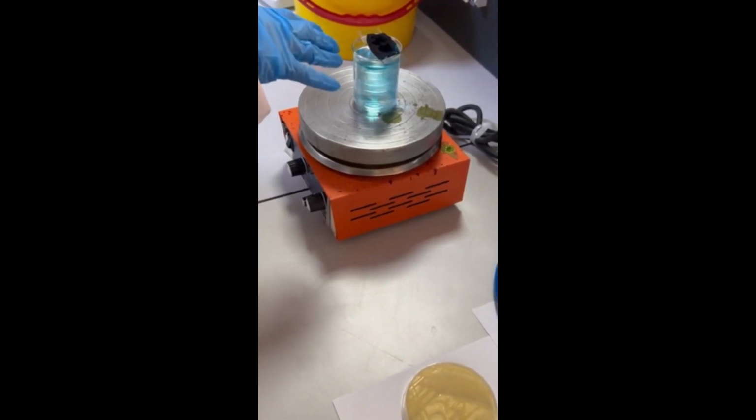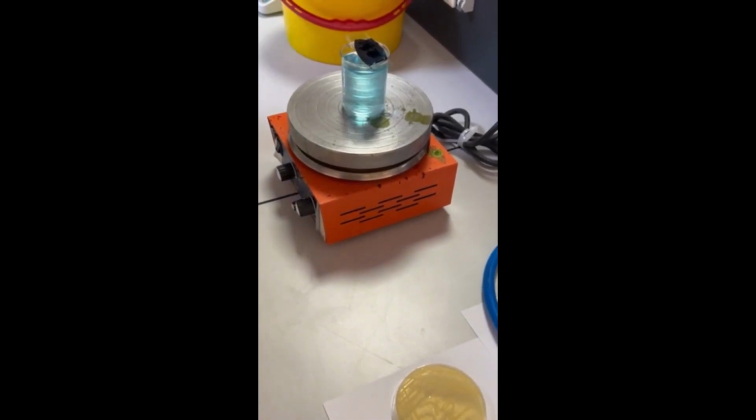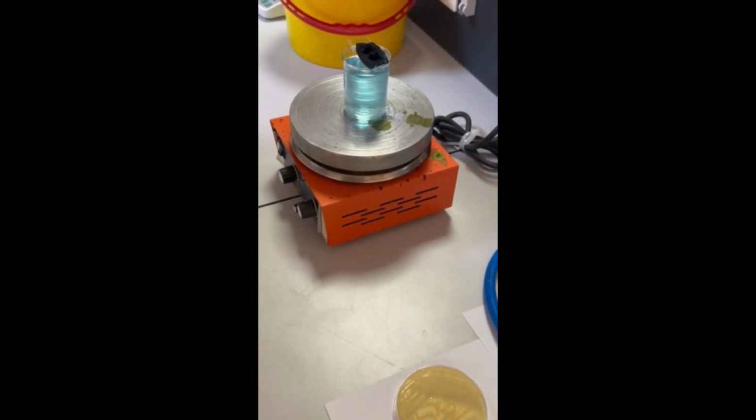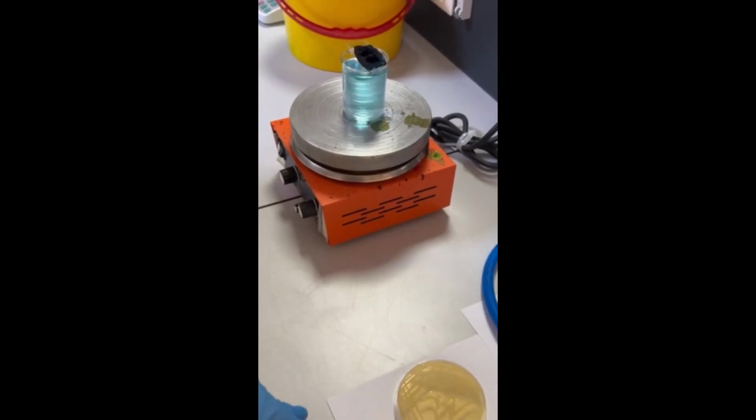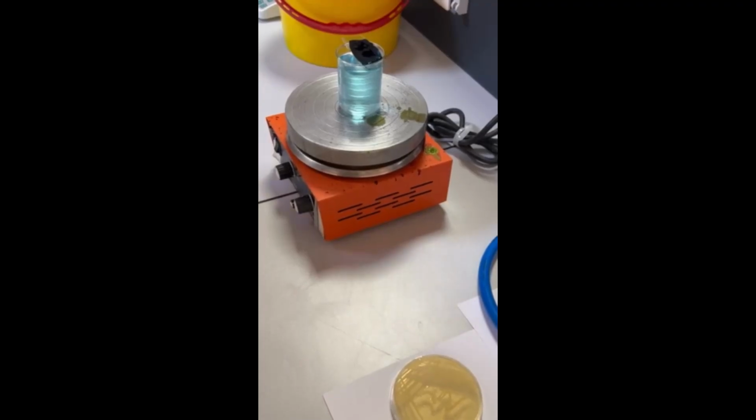During this step, all bacteria will take the green color, the color of the primary stain, malachite green, the spore and the vegetative cell.